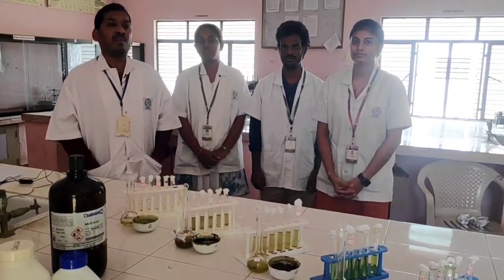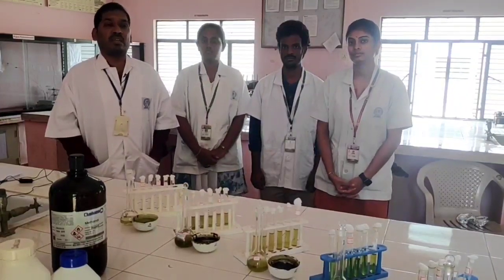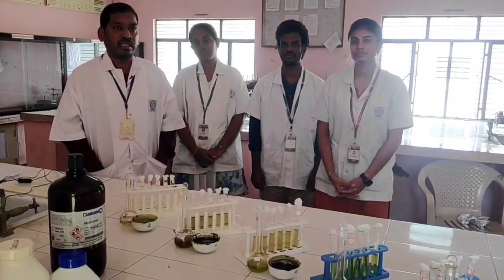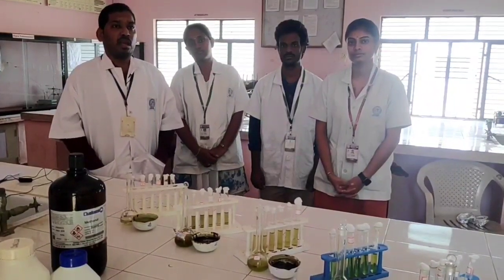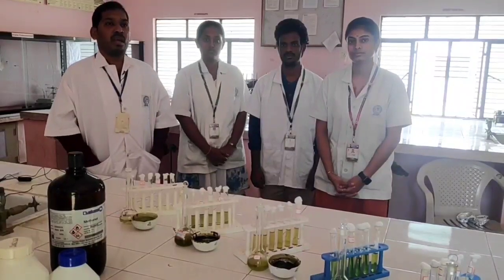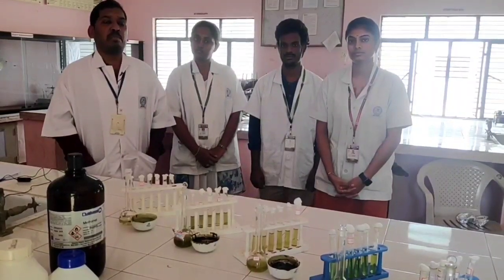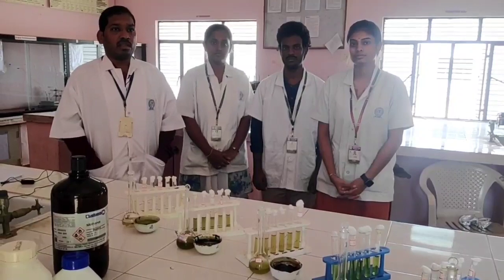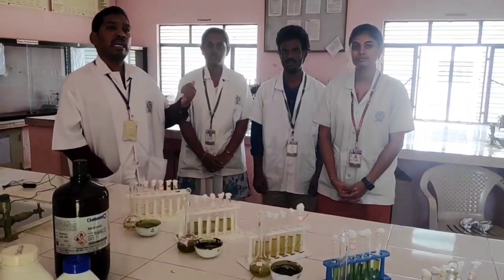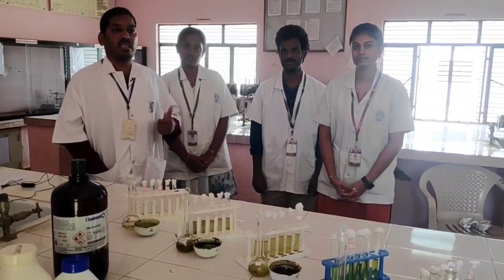These are in vitro assays. The names of the in vitro assays are: one is nucleation assay, the second is aggregation assay, and the third is calcium oxalate depletion assay. These students will explain each procedure.